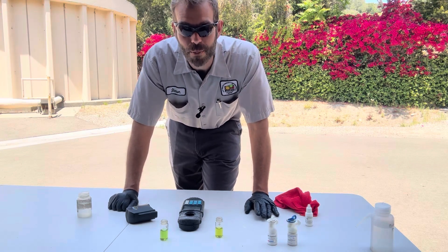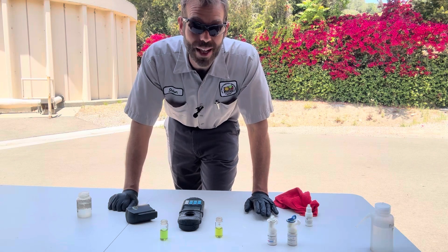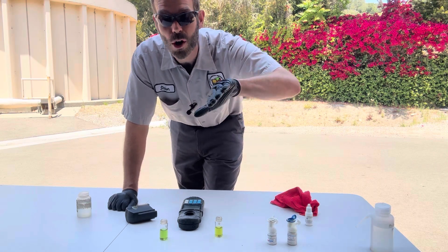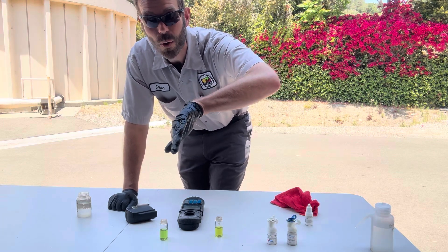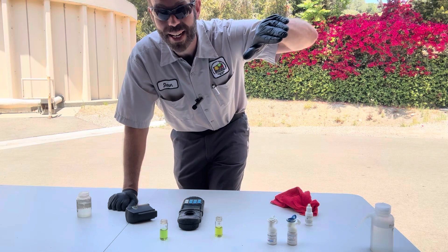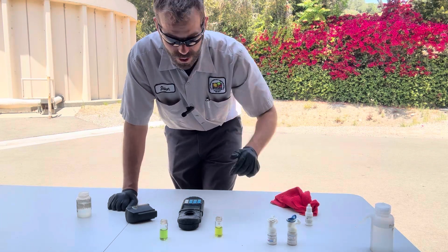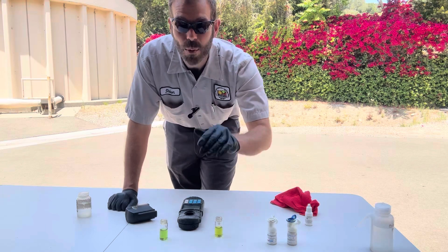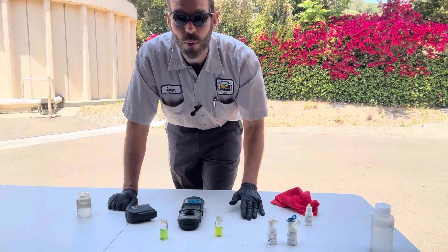I'm going to guess that in the end I'll actually decide to break point, because that's not a lot of free ammonia left. But let me start by backing the chlorinator off - there might not be all that much ammonia to begin with. What I like to do first is back it off to make sure I'm not on the wrong side of the hump going towards the breakpoint. If I back off and I'm on the wrong side of the hump, I might actually increase my chlorine residual. I'm going to go do that on SCADA and come back in about 30 minutes.